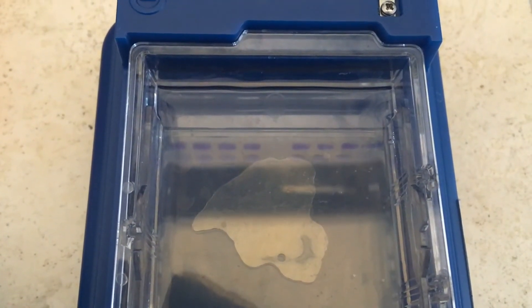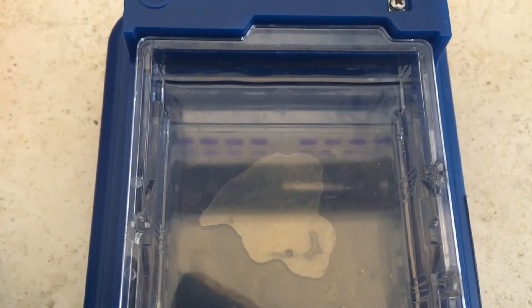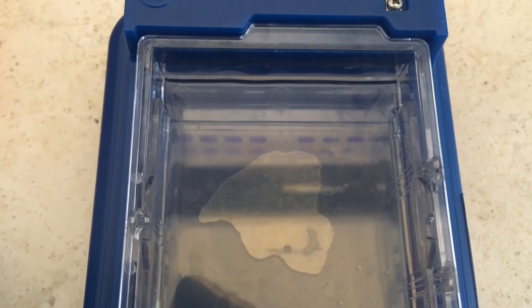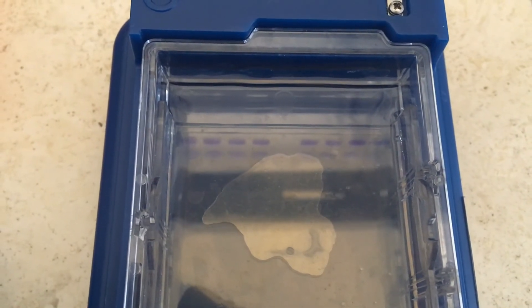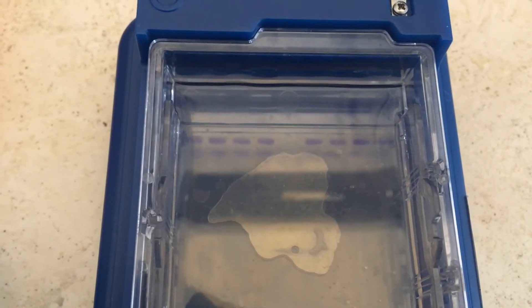And here we are. I filled eight of the wells with the mixture of the fungal DNA and the loading dye. I made a little mistake there and I left one blank in the middle but I still had room for all eight of them.